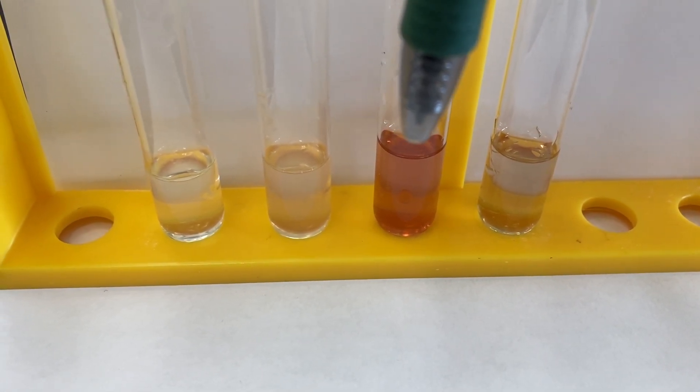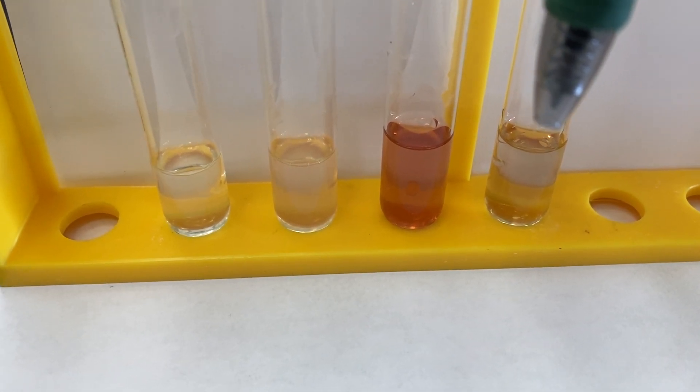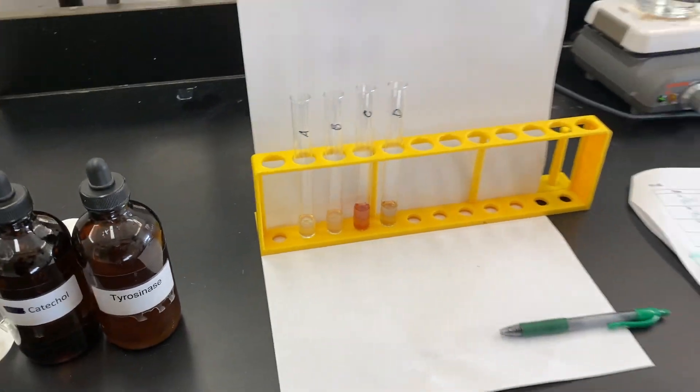Third test tube, test tube C, pH 7. Fourth test tube, pH 9, with sodium carbonate.